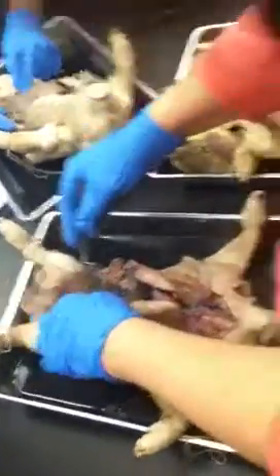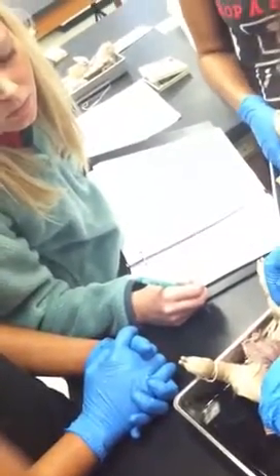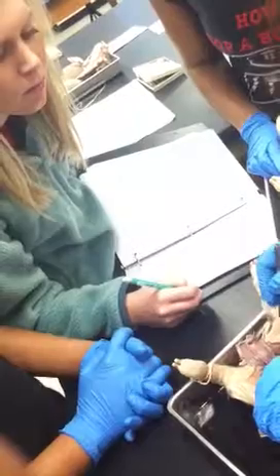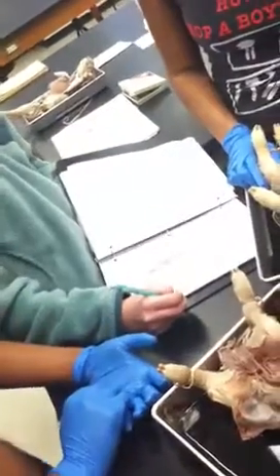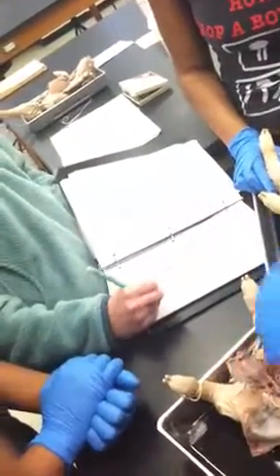So, and again here it might be a little better on this side. So this is common, and then common, and then this one follows. This should be external, there should be an internal one right in there. The medial sacral, you almost have to just keep getting your paper towel in there, and it's a really, really small artery that goes from the back there and heads to, there you can kind of see it, it's pink way at the bottom, heads to the back.